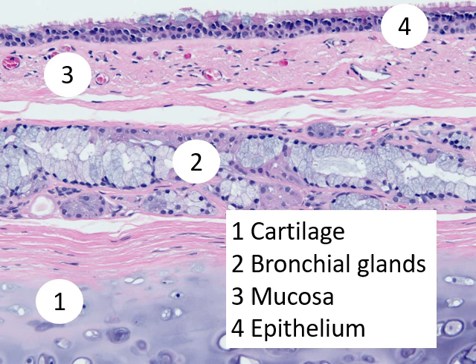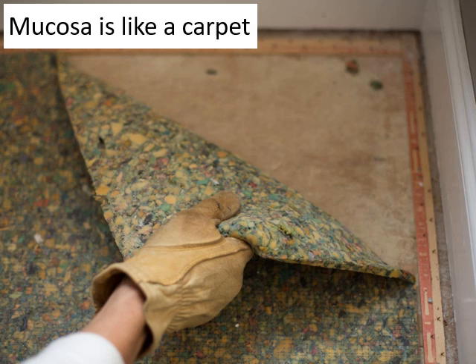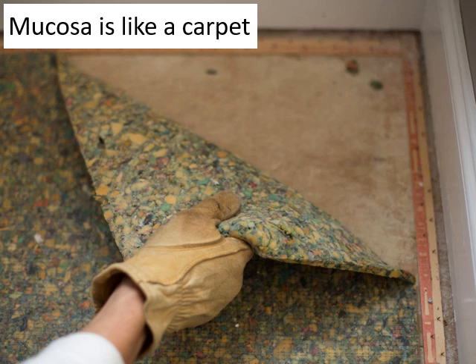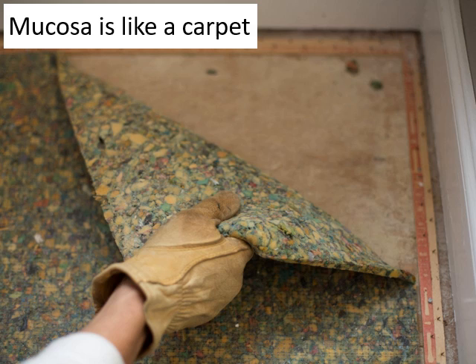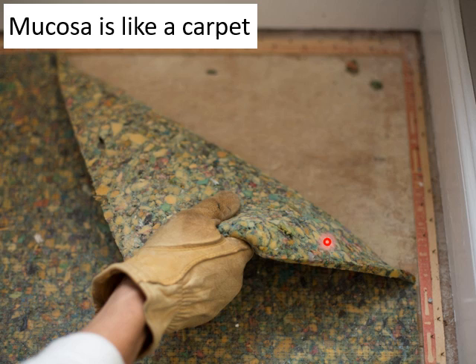To summarize at low magnification: cartilage, bronchial glands, mucosa, epithelium. The mucosa is the innermost lining found in many organs throughout the body — the gut, urinary bladder, mouth, and respiratory tract. You can think of it like a carpet lining the inside of the bronchus. The innermost part of the mucosa is the epithelium — the layer a bronchoscopist sees.